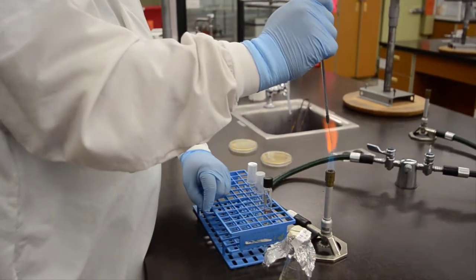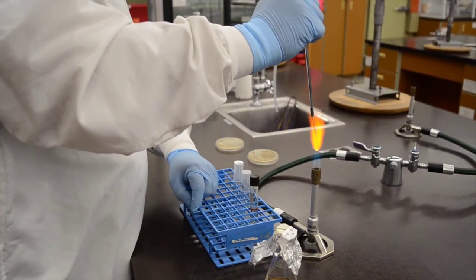And as always, terminally flame your loop.